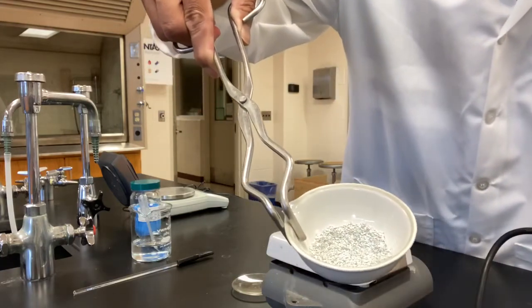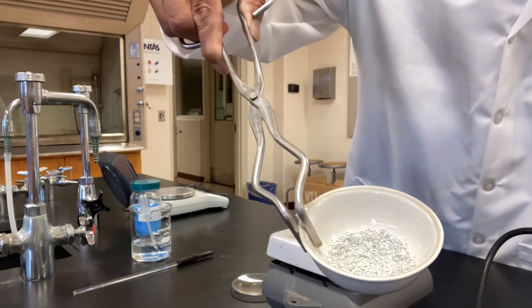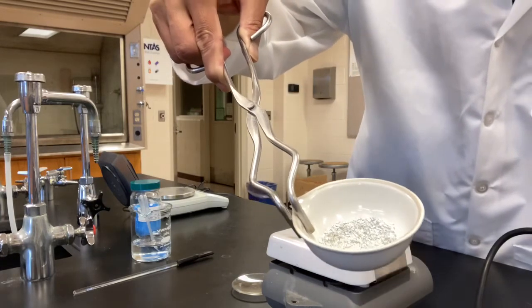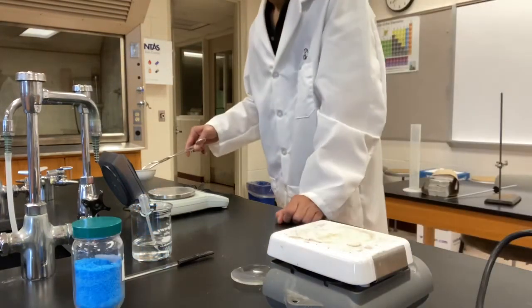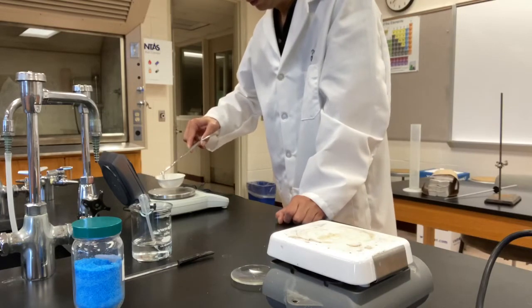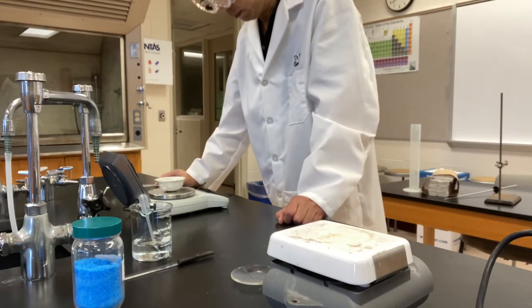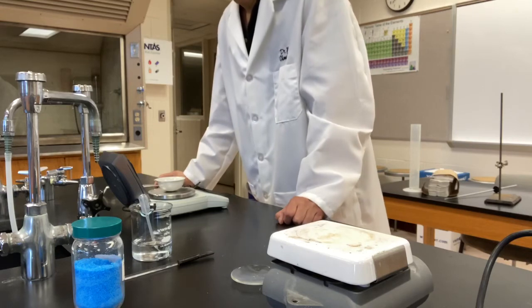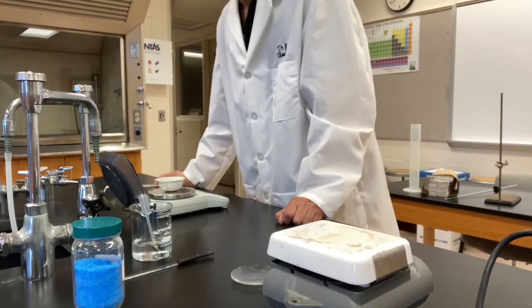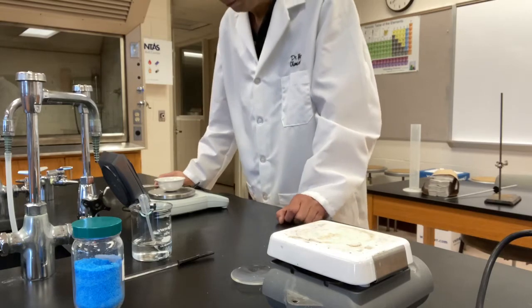All right, the color has become gray-whitish. There's no blue color inside the sample. So it should be dry now. Let's take a measurement of the mass. Now let's measure the mass of the sample in the evaporating dish. The mass measurement is 40.364 grams. You want to record this on your report sheet, line number 4.